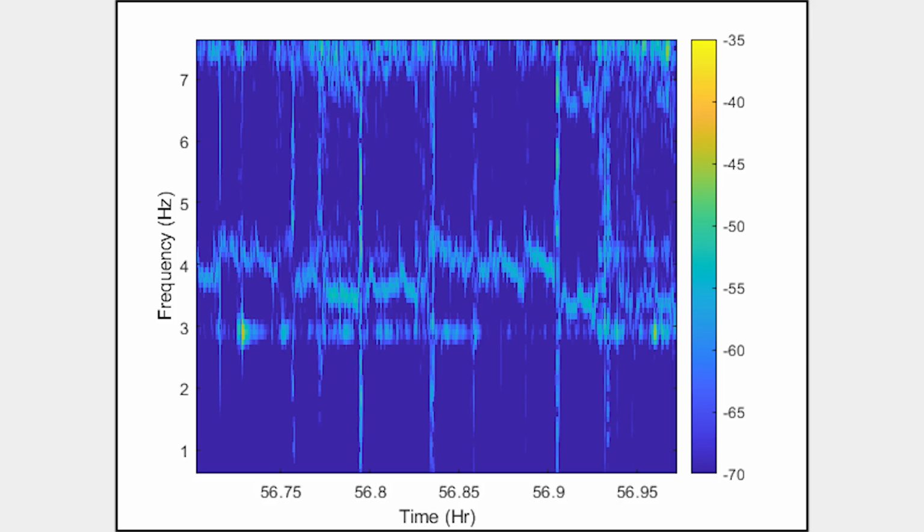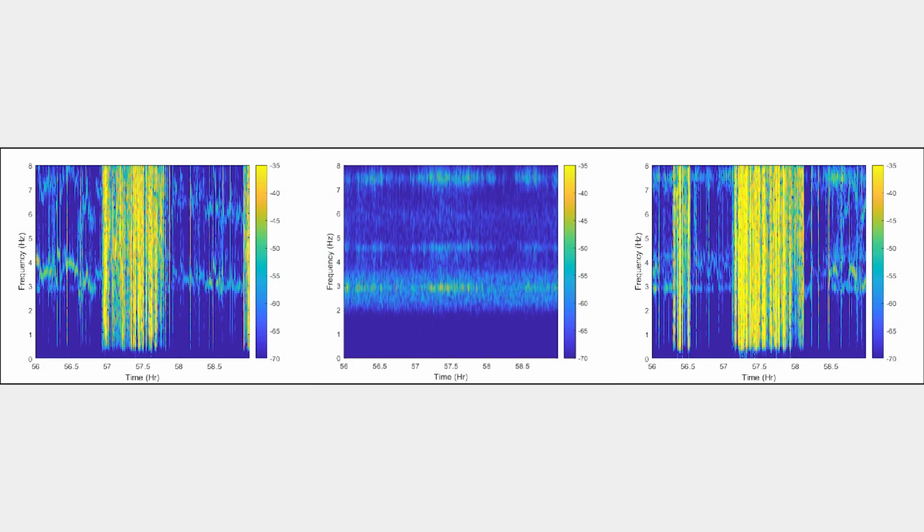Based on the last example, we can see that one cage on the same shelf had very good signal quality, while the other cage just had fair signal quality. From the comparison figures, we can see the noise power is stronger in the last cage. Shelf position can make a difference in noise levels, since there may be different levels of stiffness in response to surrounding vibrations, proximity to a vibrating source, and exposure to wind currents from vents.